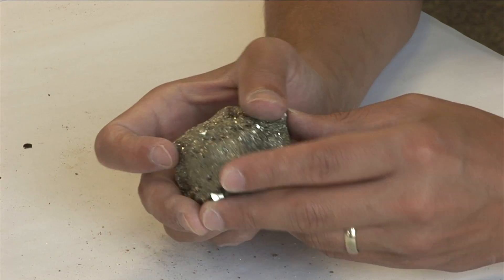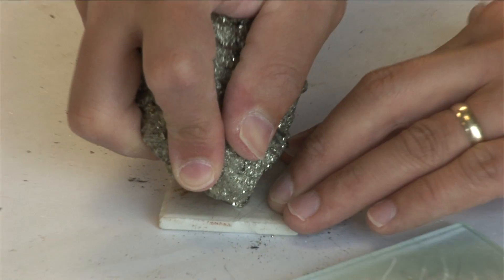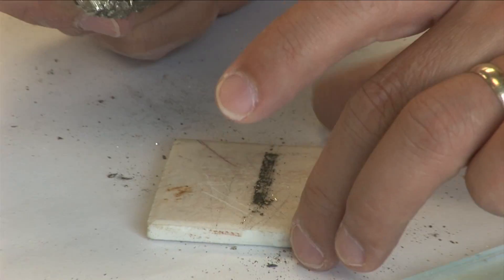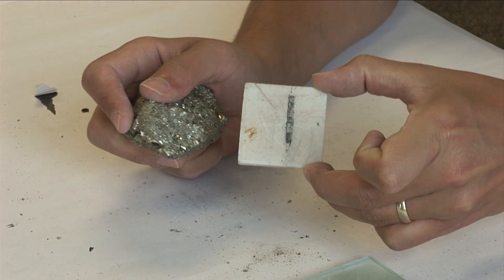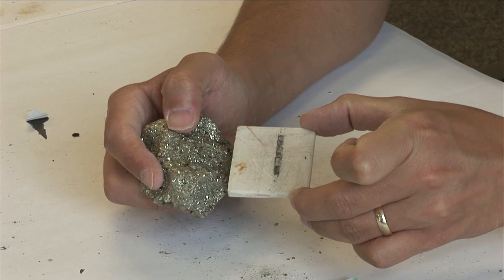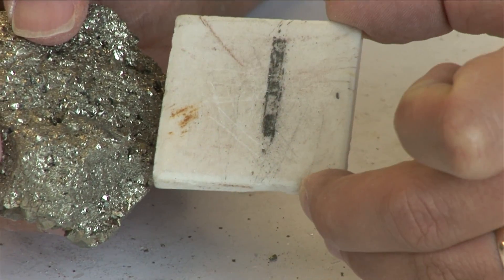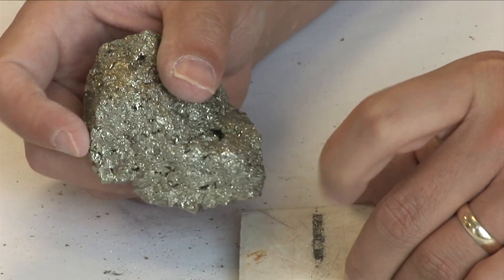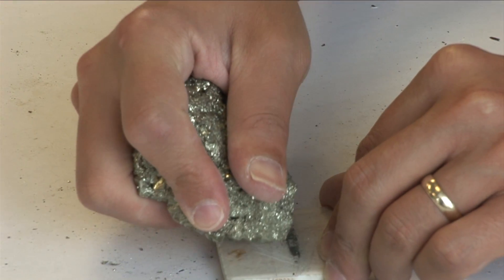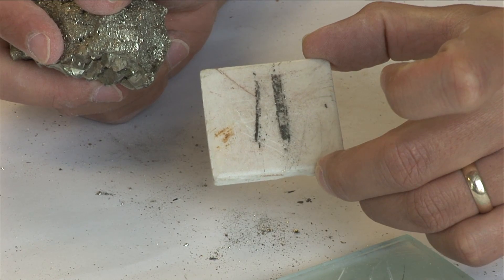Let's check its streak using a ceramic tile. Apply strong downward pressure to produce a ground, powdered sample of the mineral on the ceramic tile, then note its color. The color of that streak is distinctly darker — I would describe it as dark gray. You don't do streak by rubbing the sample; you do streak by grinding the sample against the ceramic tile.